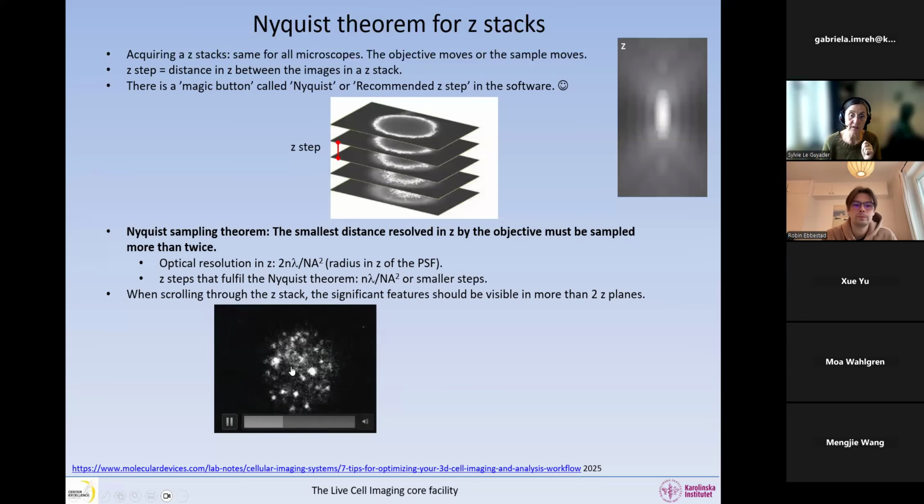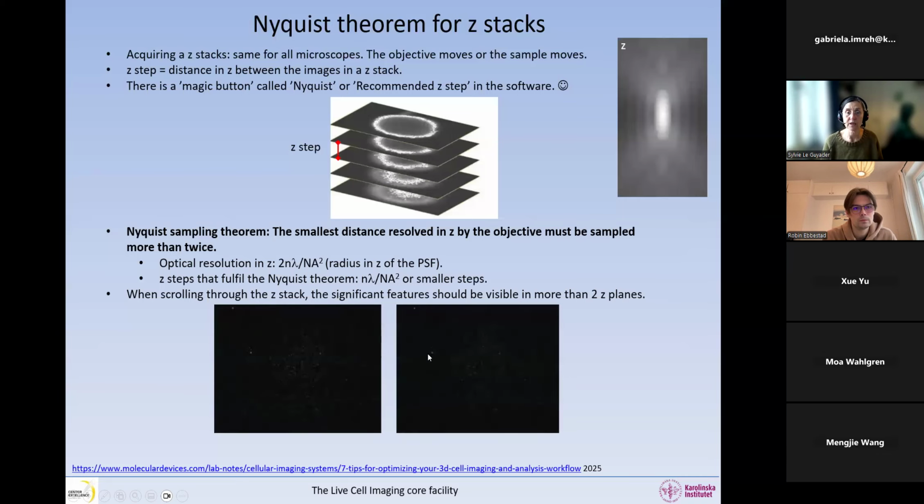What I want here is to count the number of dots. I don't want to miss any. So I don't want to have big steps, otherwise I'm going to miss them because I will not record between the Z steps. Each of these dots is in more than 2 images, and therefore it is correctly sampled. If I now acquire with big Z steps, that's what I'm seeing. For each Z plane, I'm going to see different dots, and it's very easy for me to miss some dots in between.